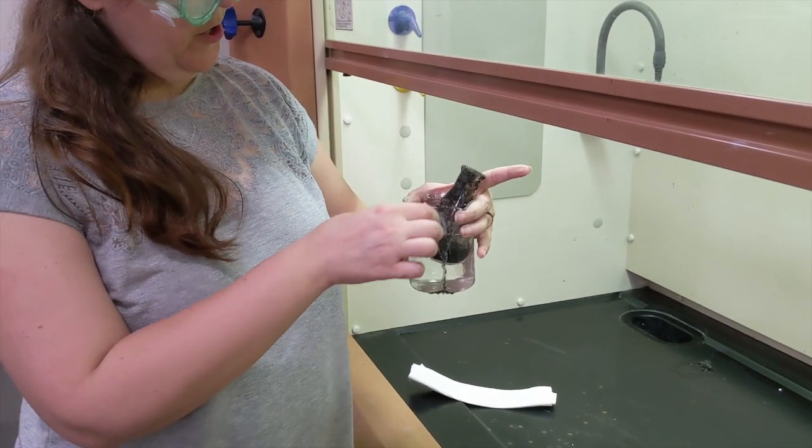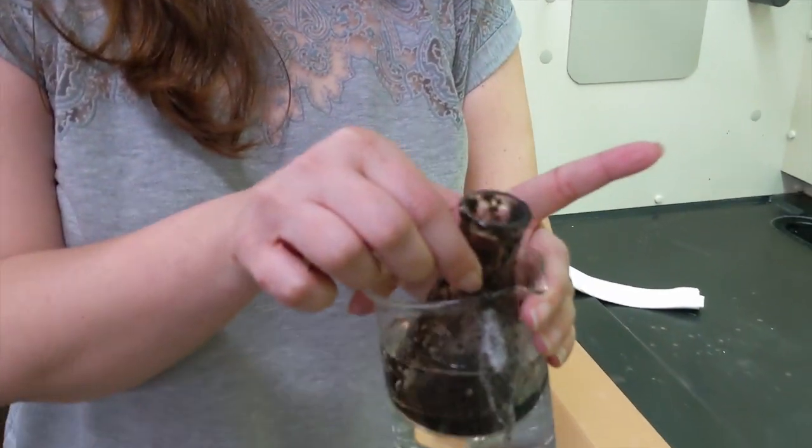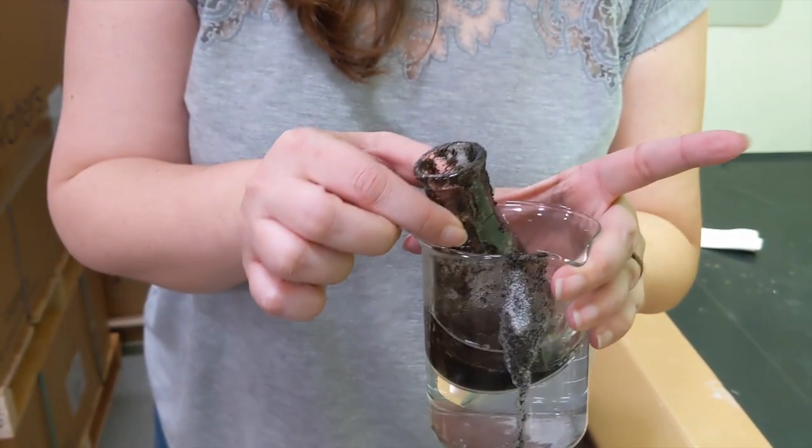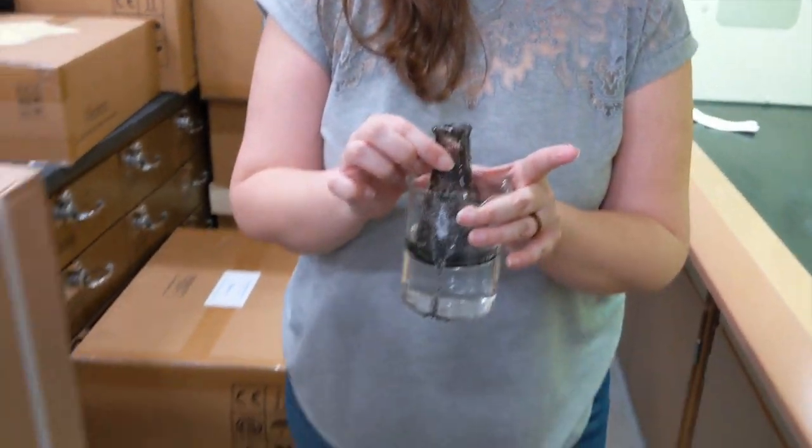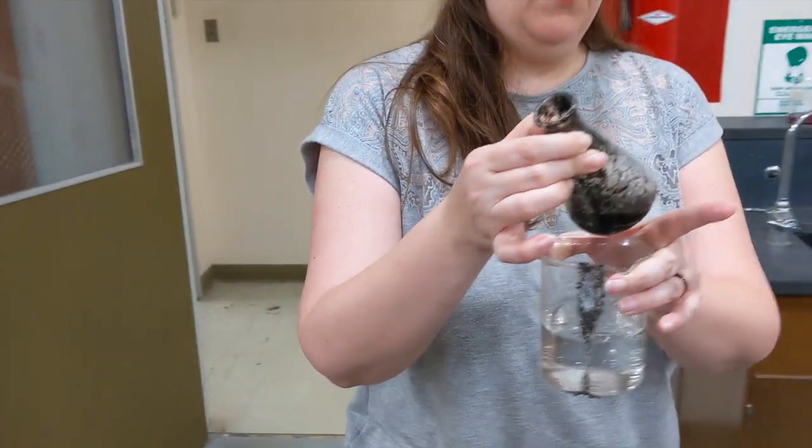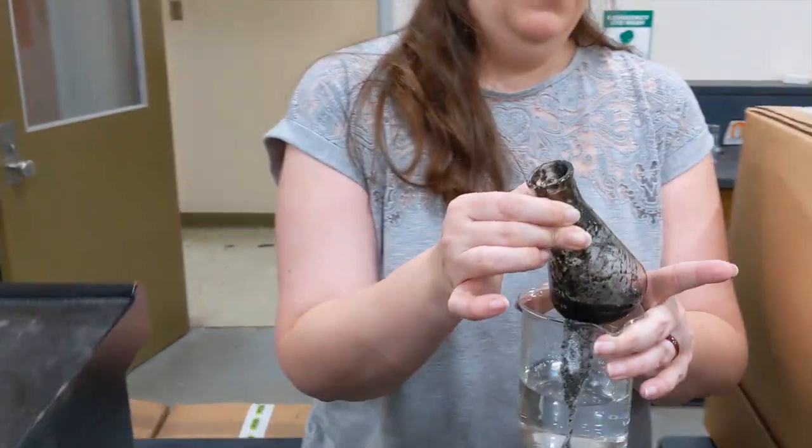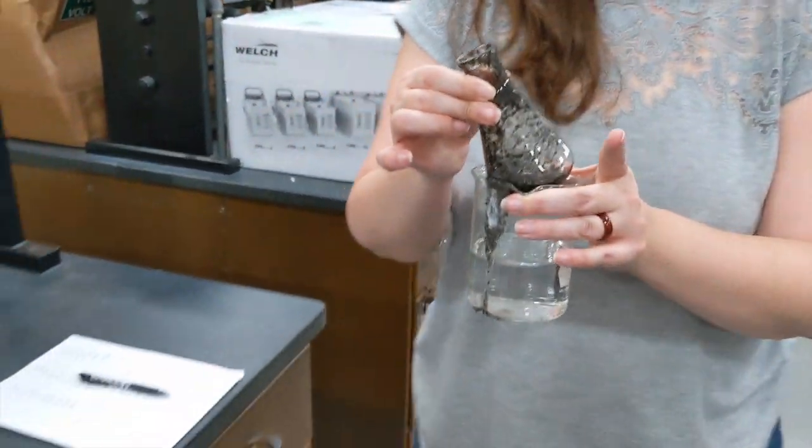I'm getting my iron out of the hood. What a mess it has made. This is such a gross reaction, isn't it? Look at that. Iron gunk all over the place. I'm going to have a cleanup job to do when we're through here. Now what I need is the iron sulfate that's dissolved in this liquid down here. To get that out, I'm going to have to get rid of that iron gunk that's still there.